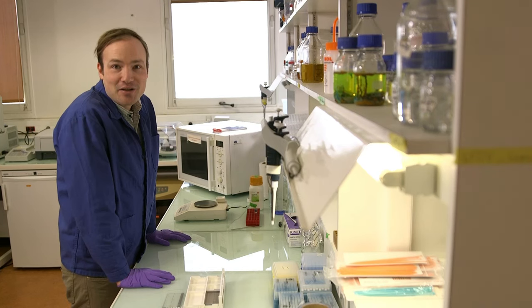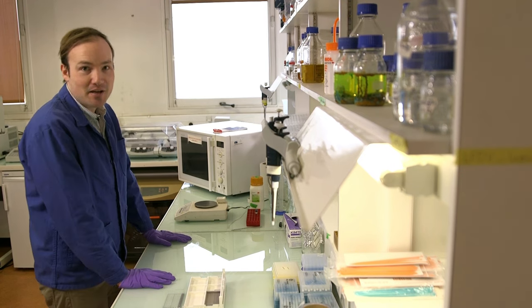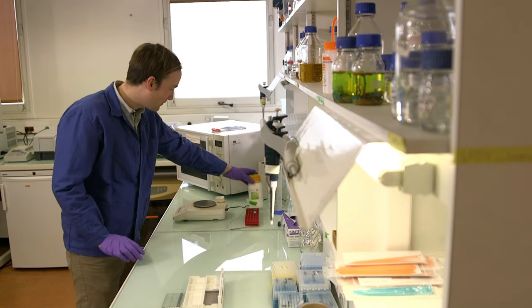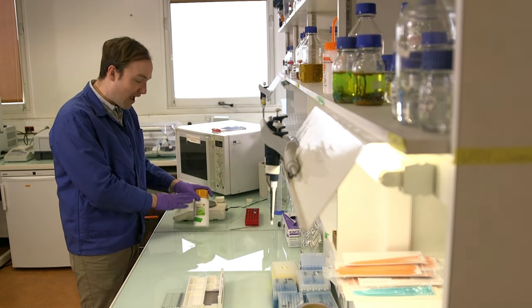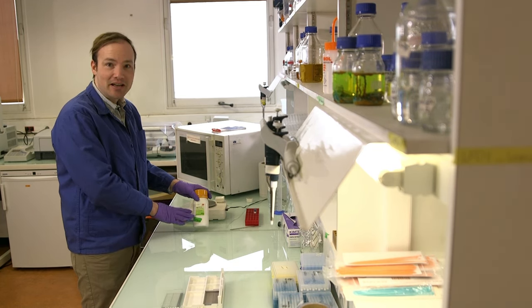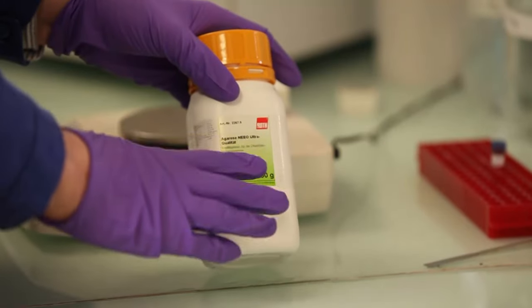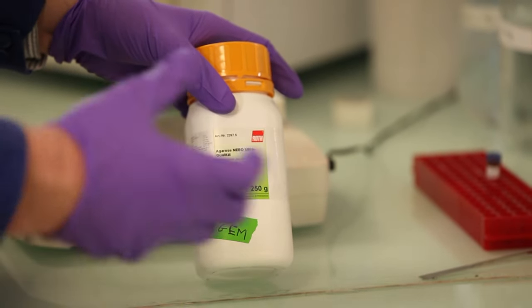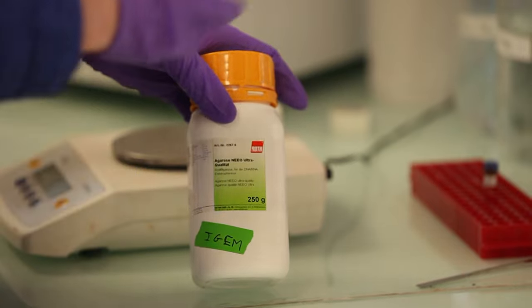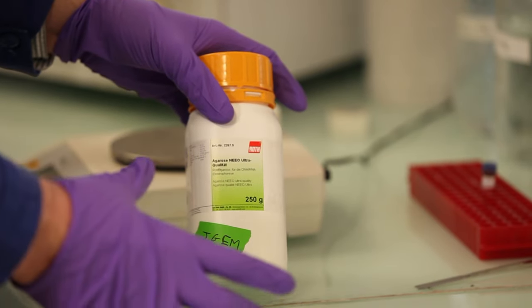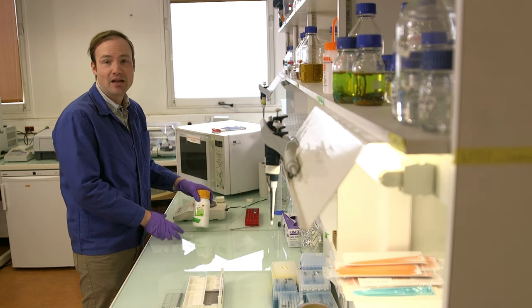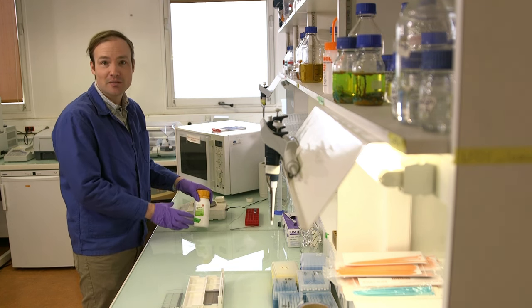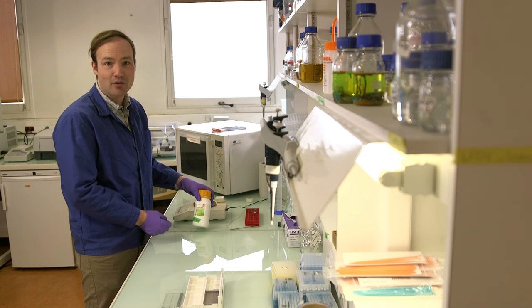The first thing we need for our agarose gel is agarose. So let's take a moment to make sure we've got the right stuff. Alright, so this looks good. It says agarose on it. Importantly, it is not agar, right? We've used agar in other protocols to prepare petri dishes, and that is different stuff. It won't work for an agarose gel. Agarose is much more refined, much higher purity, and much more expensive. So don't make the mistake of using agar in your agarose gel.